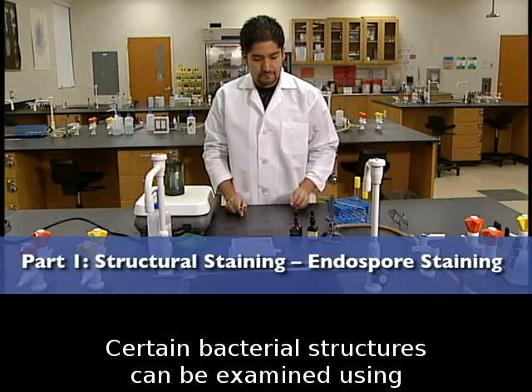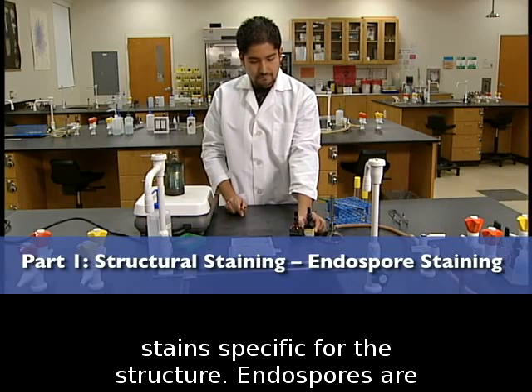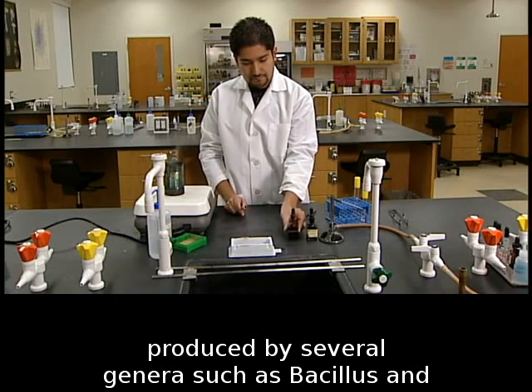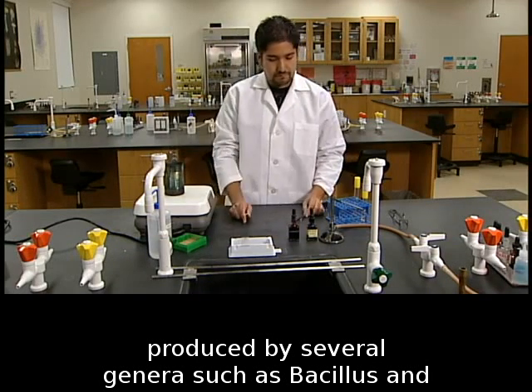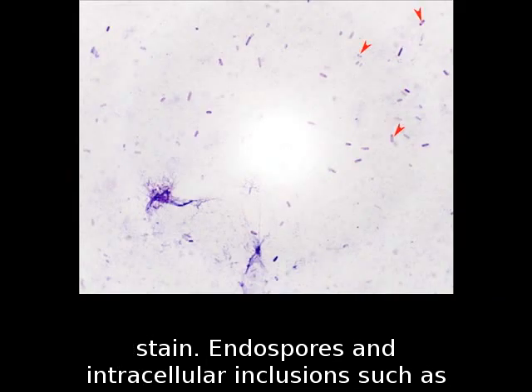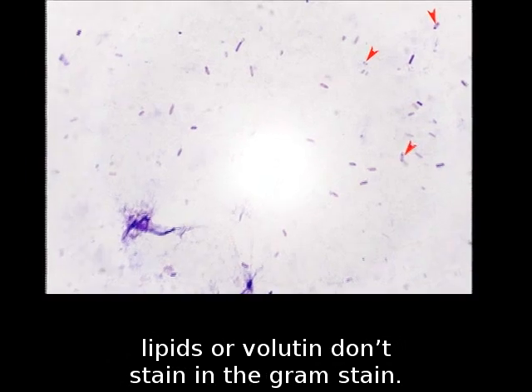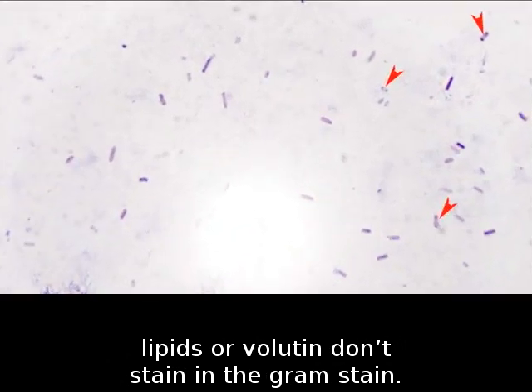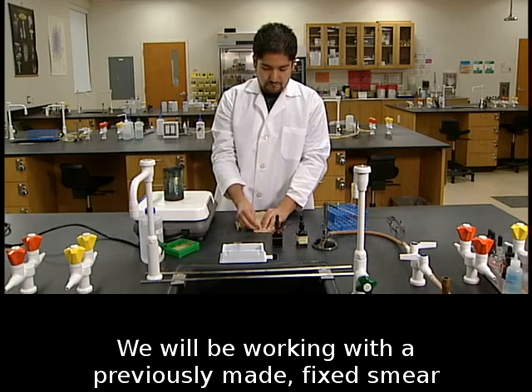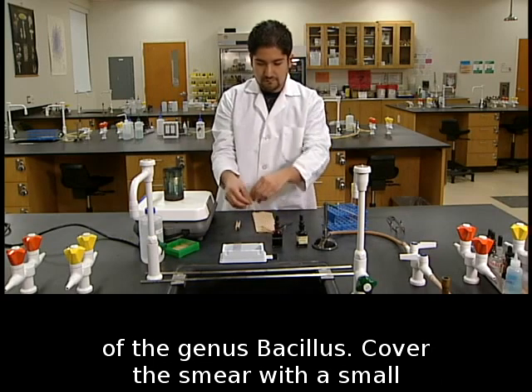Certain bacterial structures can be examined using stains specific for the structure. Endospores are produced by several genera, such as Bacillus and Clostridium, and can be identified by the endospore stain. Endospores and intracellular inclusions, such as lipids or volutin, don't stain in the Gram stain. We will be working with a previously made fixed smear of the genus Bacillus.